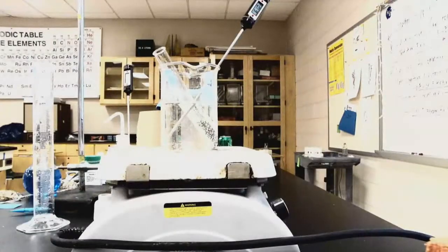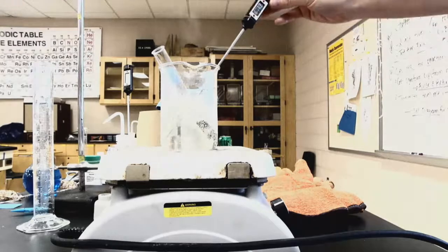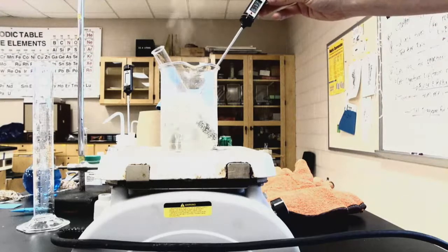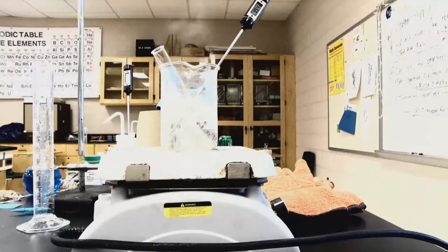All right, so just checking in on our hot water bath. Right now it's at 62 degrees and climbing. Not quite up to a boil yet. Remember, water boils around 100 degrees. So we will check back in with the temperature when it's boiling, and then we will let it sit for another 10 minutes. All right, we are at our full boil point. If you look closely at this, it should read that it's at 99.3 right now. So our water is actually boiling a little bit under 100 degrees Celsius. And we're going to let this boil for another 10 minutes.